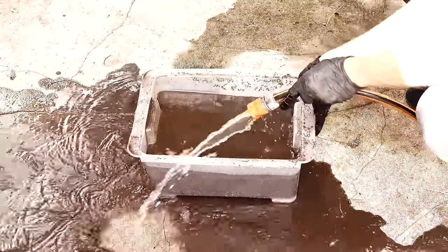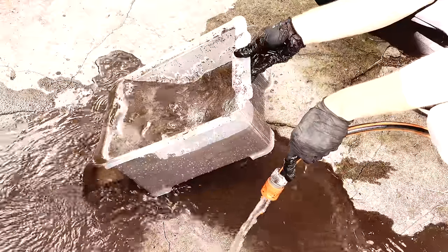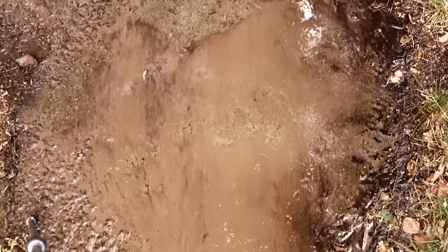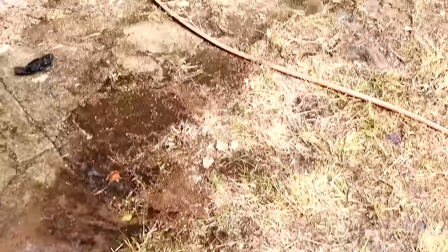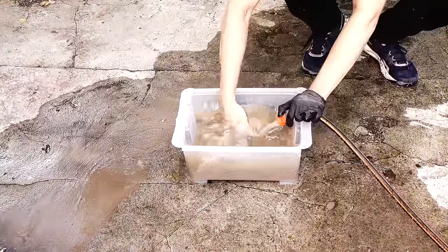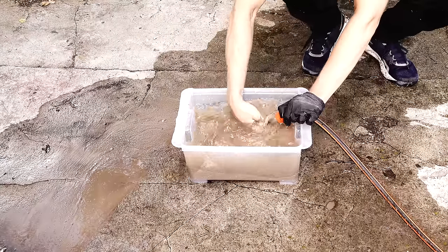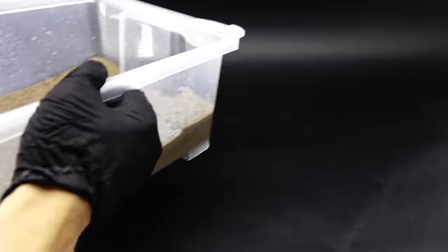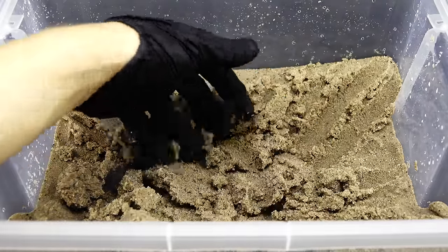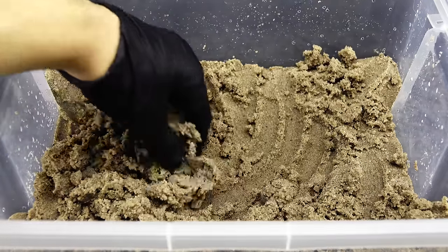I continued washing the dirt, which consisted pretty much of just filling the container up with water, swirling the dirt around, and draining the muddy water. I must have repeated this process like 50 times since the dirt was so dirty it just refused to cooperate. This whole endeavor resulted in a local flood of muddy water, and after what felt like forever, the contents of the container looked more like sand and the water got considerably cleaner. This process got rid of pretty much all the organic and lightweight stuff, as well as a ton of incredibly fine dirt dust which settled on the concrete, becoming some low-grade clay. The dirt now turned into this perfectly average sand, which was a little darker than what you would normally find.